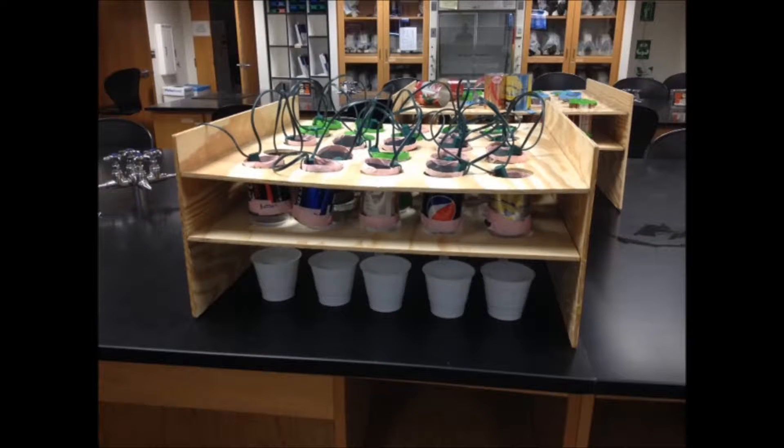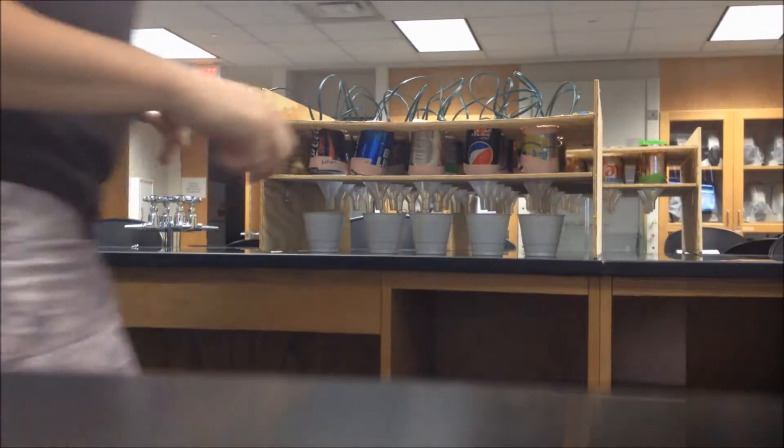The next setup we'll look at is much smaller and more compact so you can run more samples at once, but is not great for litter bags. I'll run you through the setup.